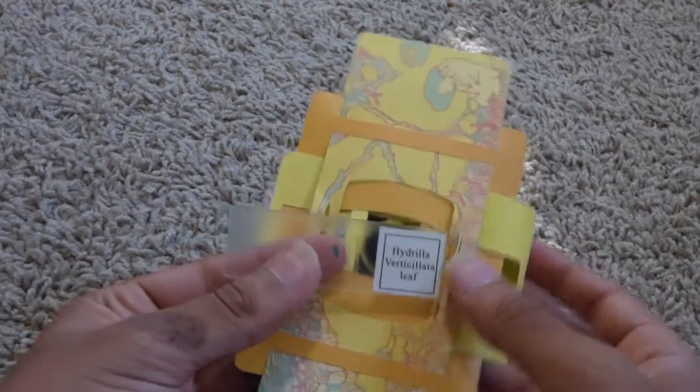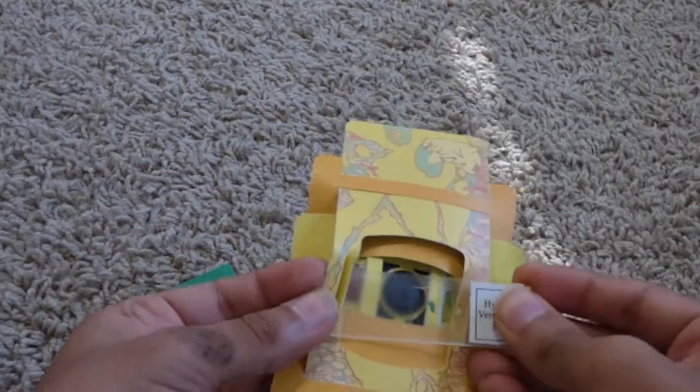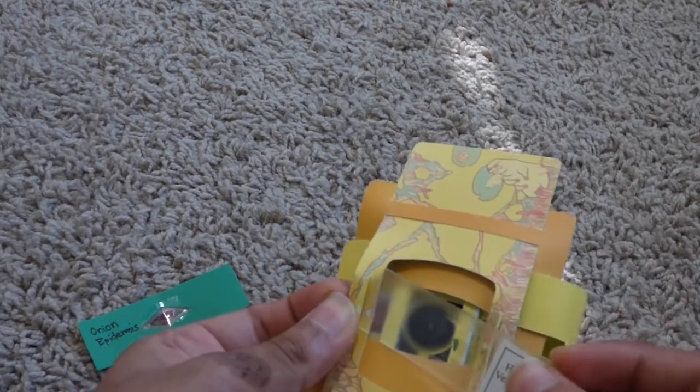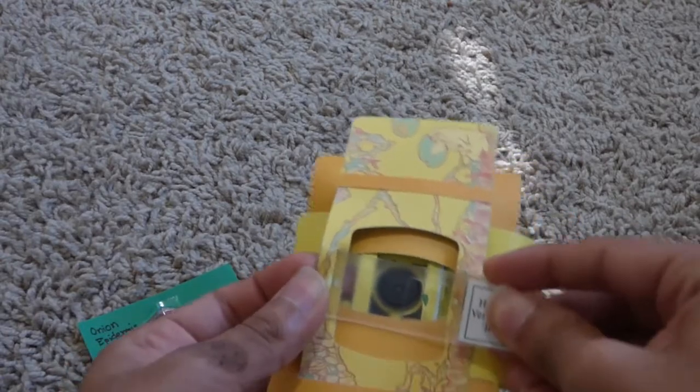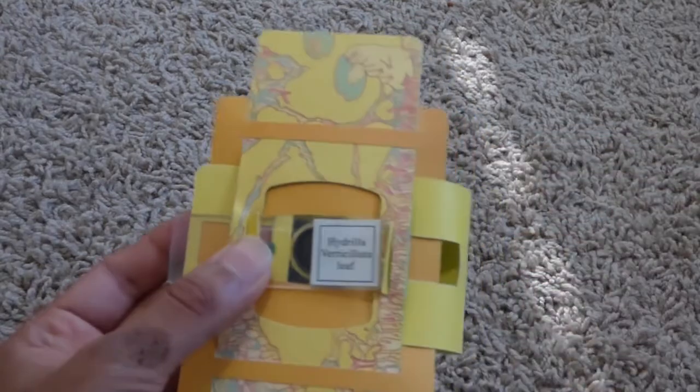Let's start out with the conventional version of the slide, our plastic slide. I'm just going to locate the area in between this little flap right here and the surface below, where the two arrows are pointing, and then slide the edge of the slide in. I'm going to close the flap.